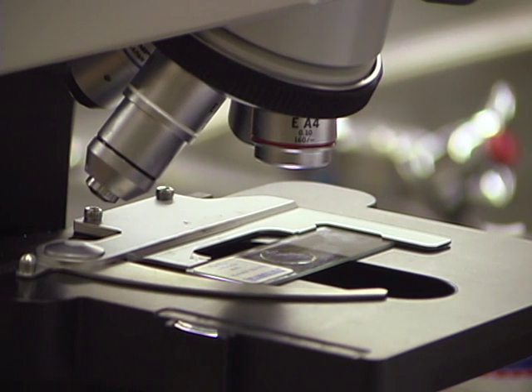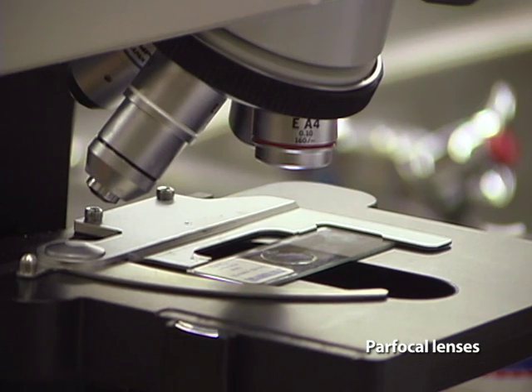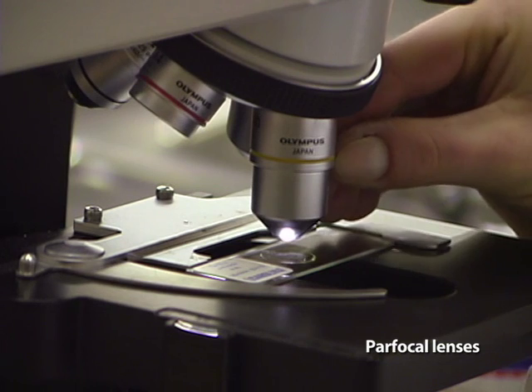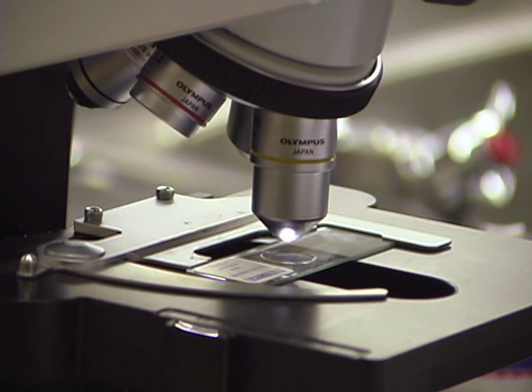Good quality microscopes also have objective lenses that are parfocal with one another. Parfocal means that once you focus with the lowest magnification and switch objective lenses to higher magnifications, the object will remain in fairly good focus, perhaps needing only a minor adjustment of the fine focus knob.